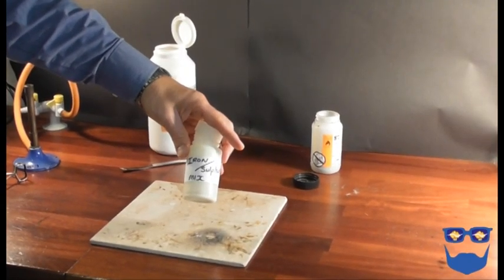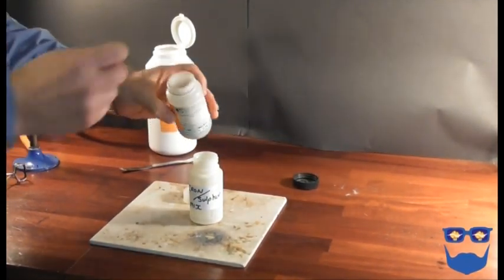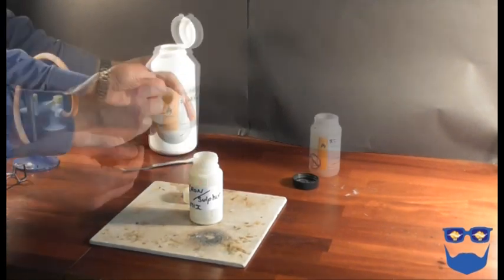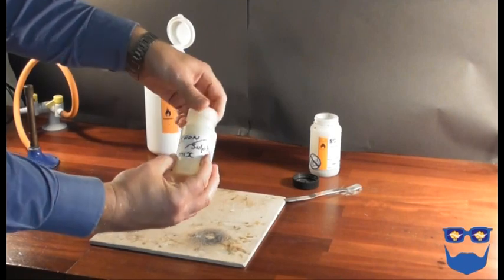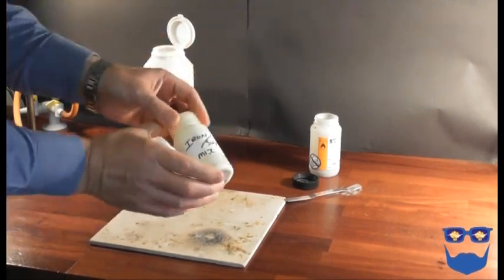Prepare a mixture containing iron powder and sulfur powder in the ratio of 7 parts iron to 4 parts sulfur by mass. Either you should do this for your class or ask your technician to prepare it beforehand.